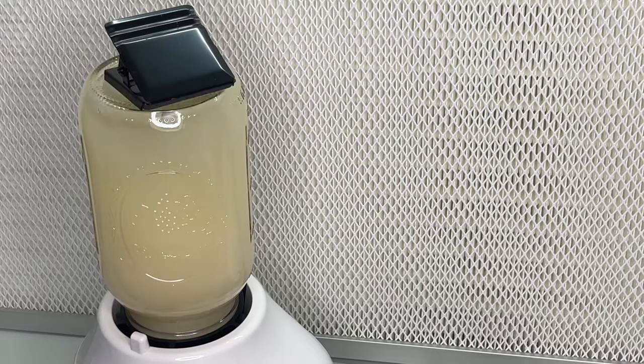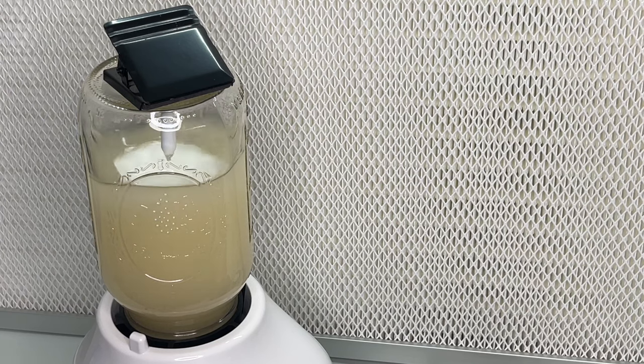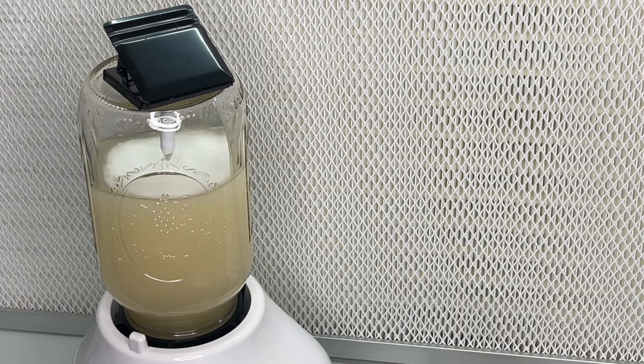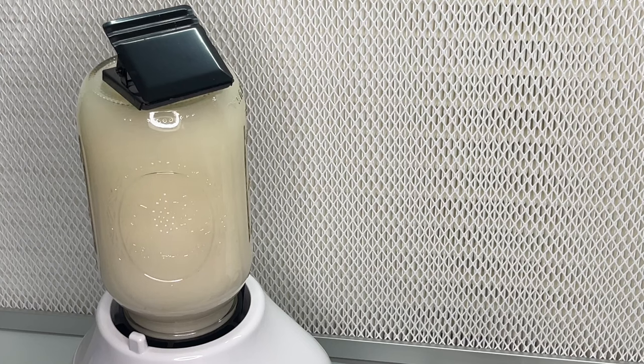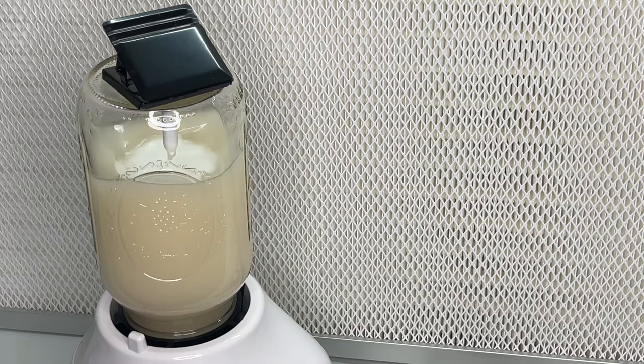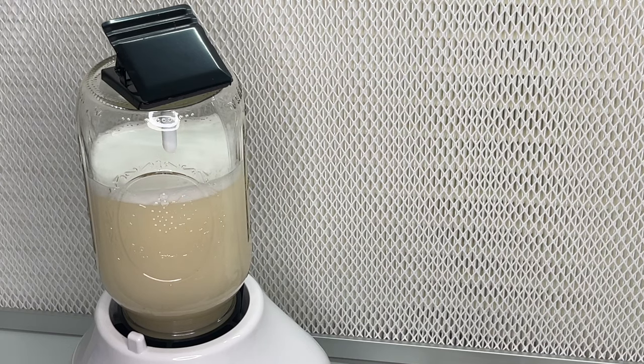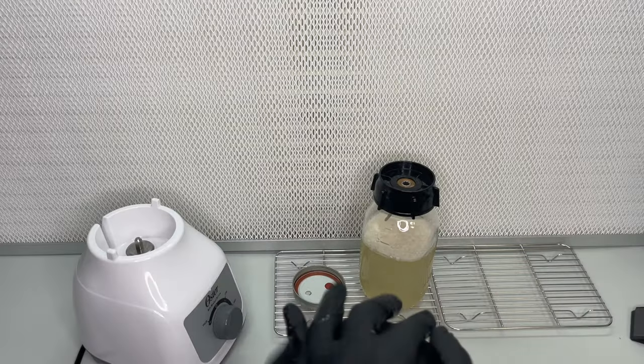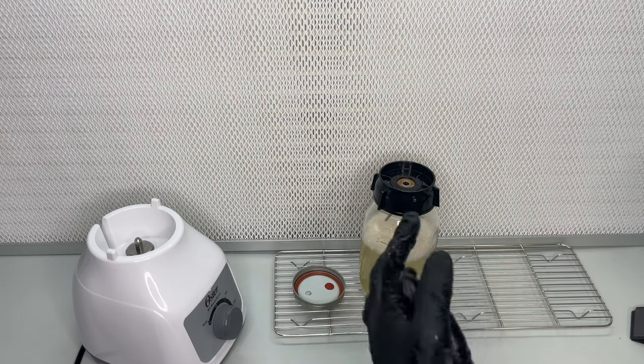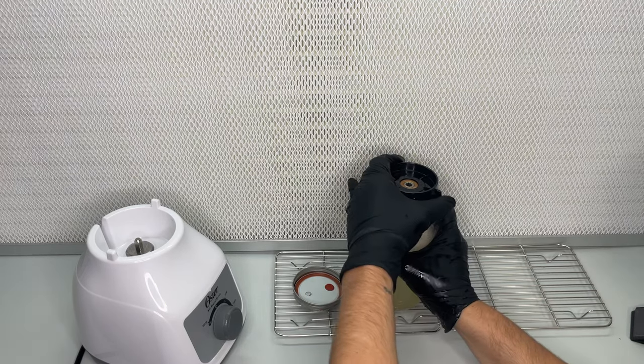The blender seems almost too powerful even on low mode, so I think next time I'll use a hand drill to spin the blade. It should only take a few seconds to pulverize the mycelium and then you can reattach the original lid.